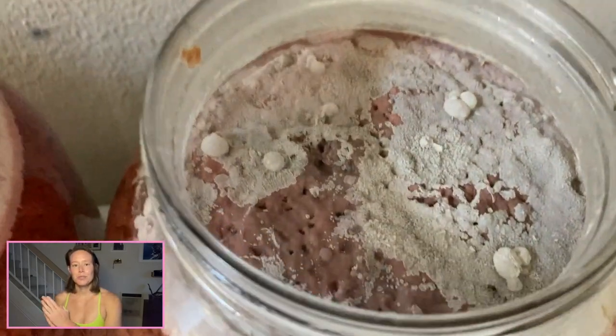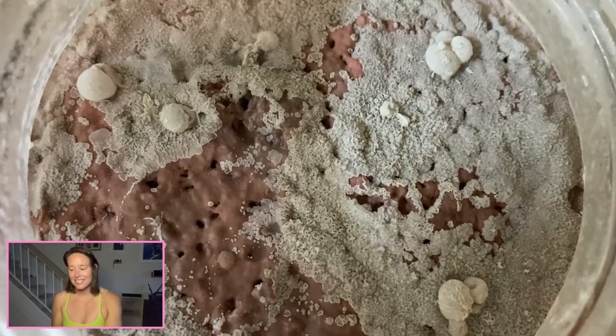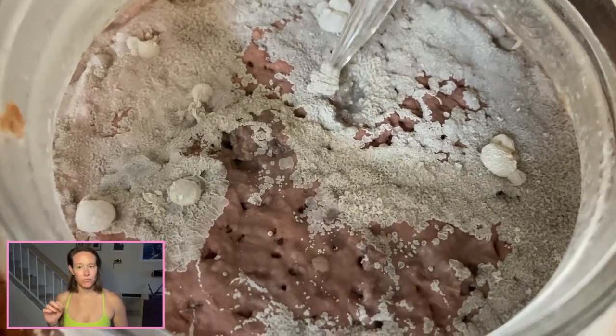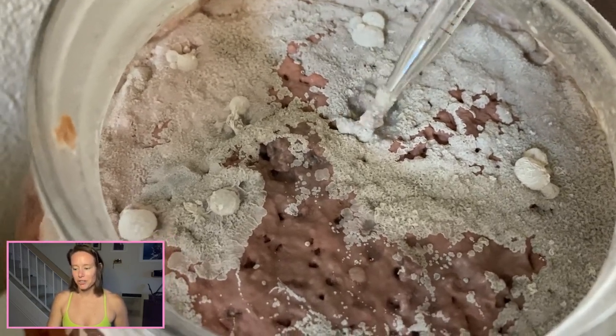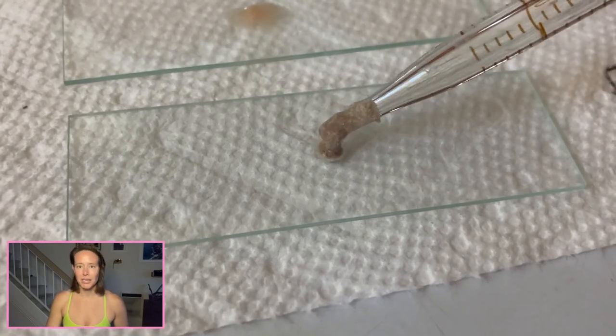This is the experiment that was pitched using my pomegranate wine yeast. This one smelled like a really musty red wine. So before even looking under the microscope, I would also think musty, probably a Brett species.